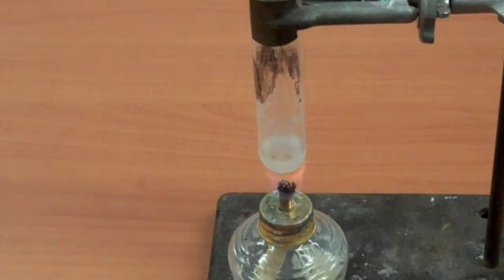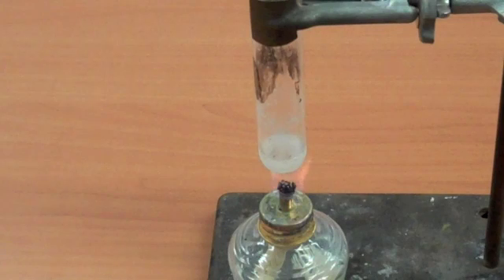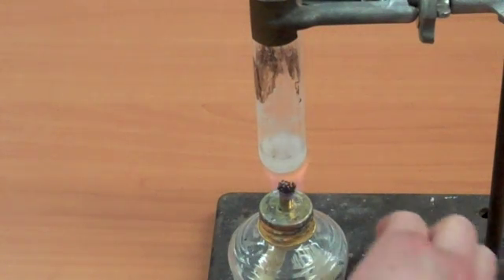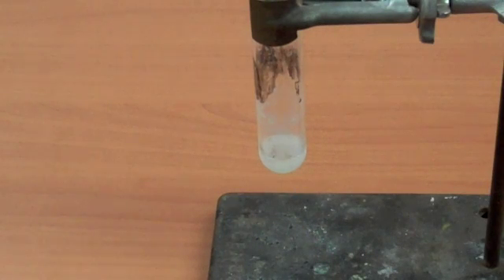Since we're inside, I am going to take half of this gummy bear. I'll eat the other half. And we're going to put it in my melted sodium chlorate, my molten chlorate.